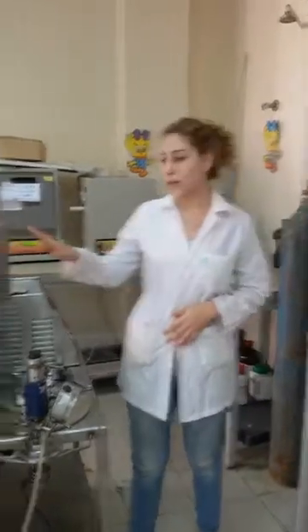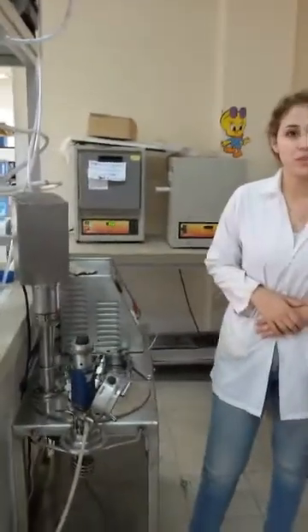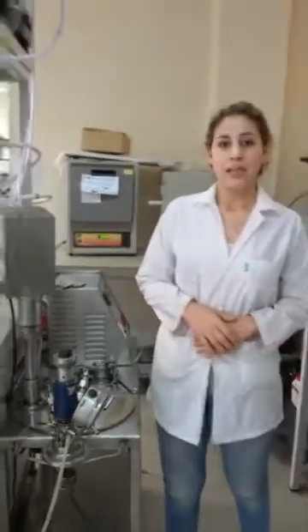Hi guys, my name is Leal Mahfoud. I am a student at Al Baath University. Today I'm going to show you what a batch reactor could consist of and how I can use it during my experiment. Let me first explain its parts.